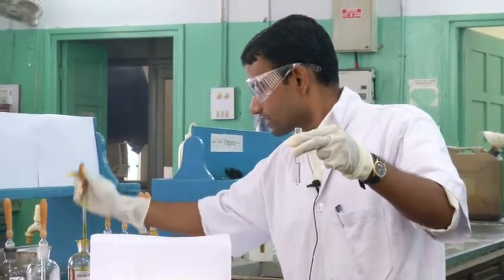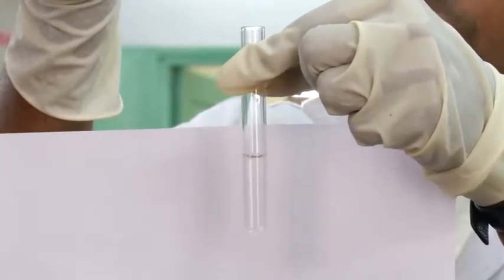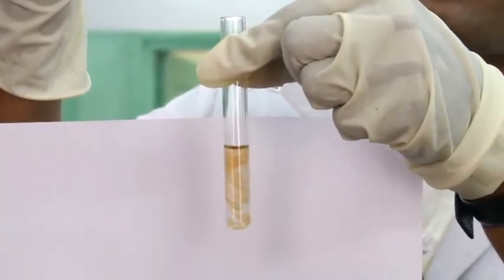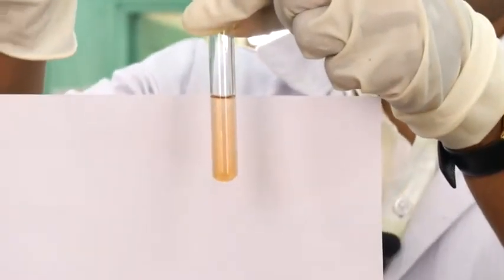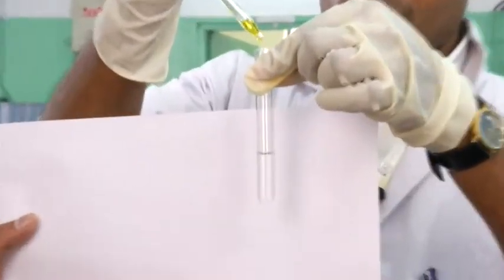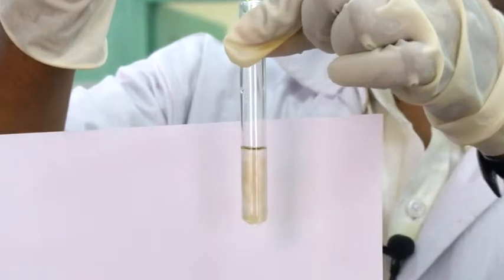Here is our ferric chloride solution. Somic charge will help me place a white paper background so we can get a better view. I am adding ferric chloride and let us observe, when the ferric chloride is dissolving in the solution, what coloration takes place. You can see it — there is a transient green color. If I do it again it is already yellow because the quinone has formed and the complex no longer exists. Let me do once more with another solution — one drop. You can see a nice color but it will not survive more than a second.